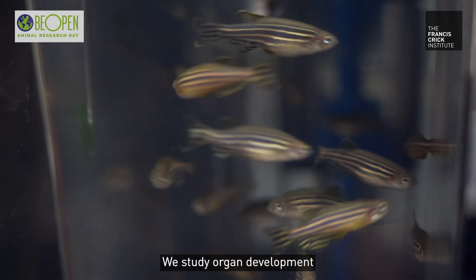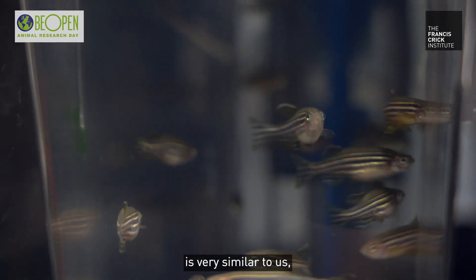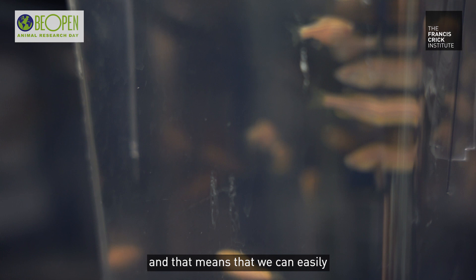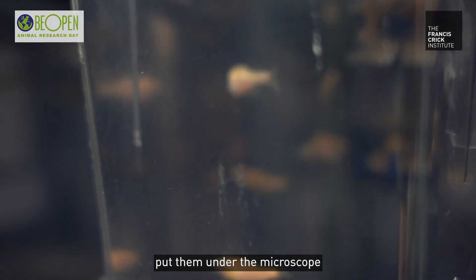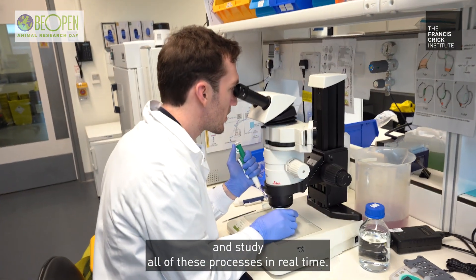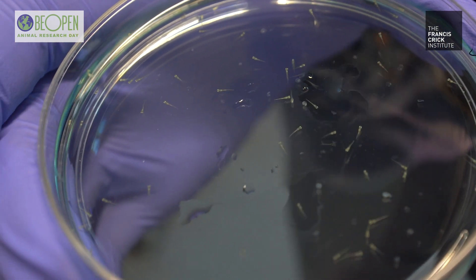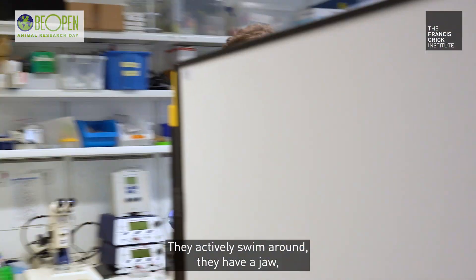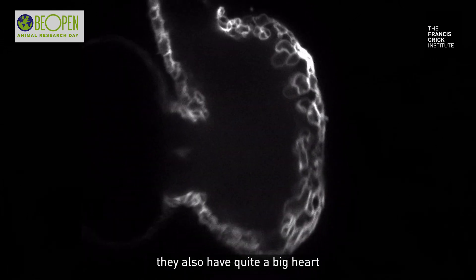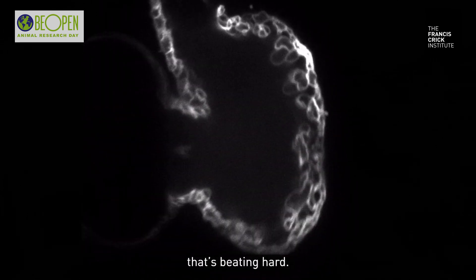We study organ development in zebrafish because their development is very similar to ours, but they're small and very transparent, which means we can easily put them under the microscope and study all of these processes in real time. These are now five days old — they swim around, they have a jaw, they're looking for food, and at this point they also have quite a big heart that's beating hard.